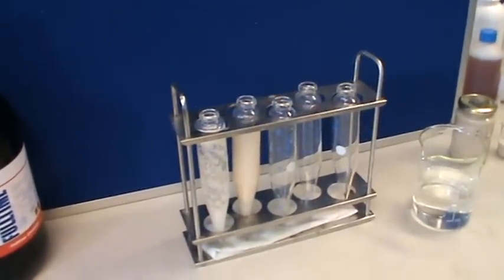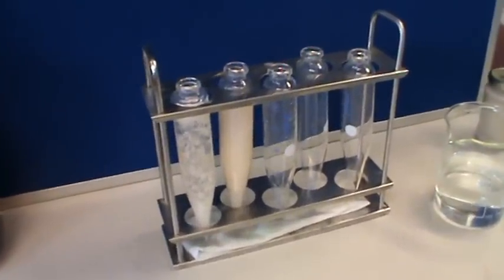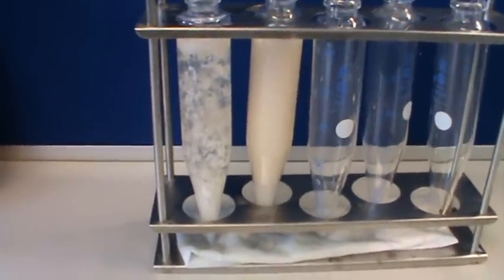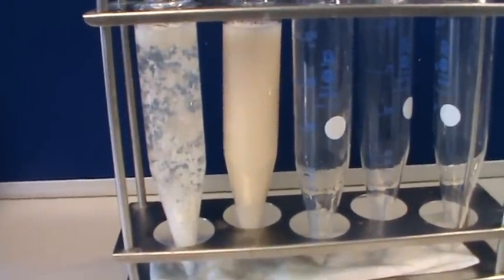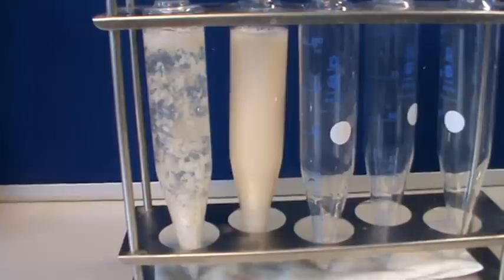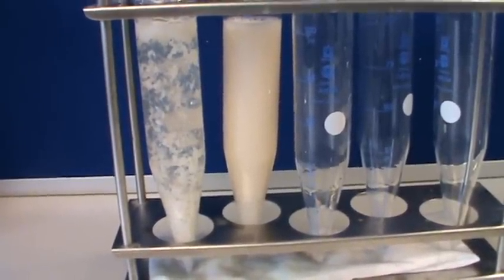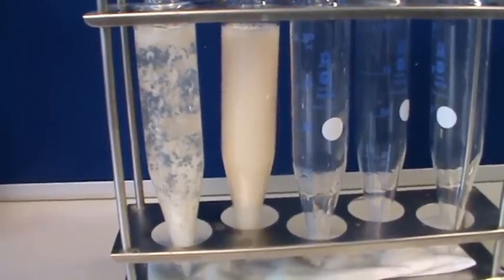And there's the comparisons. It's already fairly obvious to me, Martin, which I'd like in my tank, and it isn't that first one you did. That flocculation looks to be flocculating together, because those almost crystal forms in there seem to be getting bigger, so I wouldn't want to try and push those through a jet as a grower. No, you'd probably screen your pumps or your filters with that.